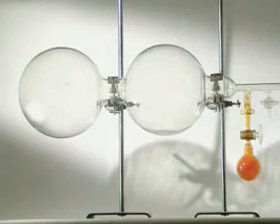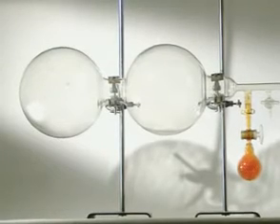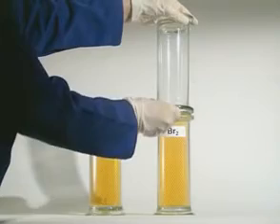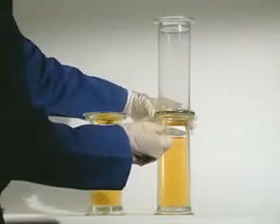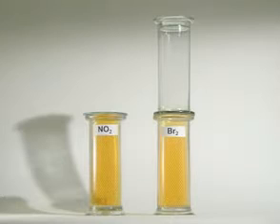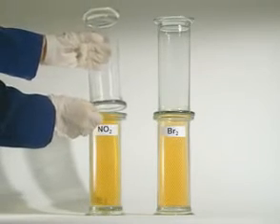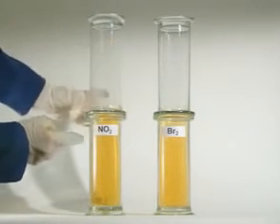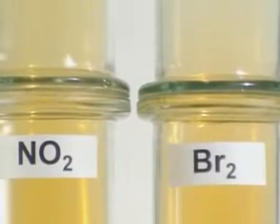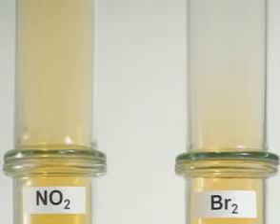See how slow the diffusion is when the flask is now full of air — it takes several minutes to get just this far. This simple setup can be used to compare the rate at which different gases diffuse into air. Nitrogen dioxide gas on the left is similar in colour to bromine on the right, but bromine molecules are much heavier. The lighter nitrogen dioxide diffuses more quickly.